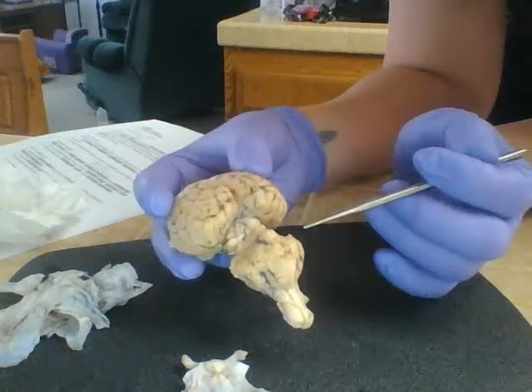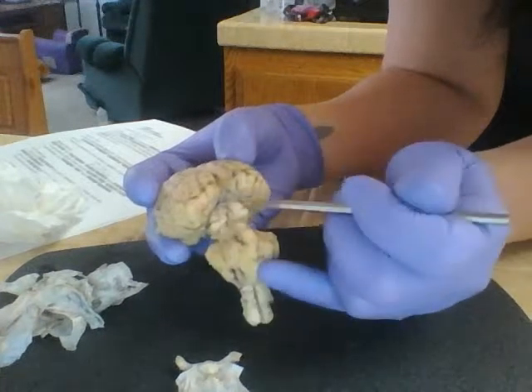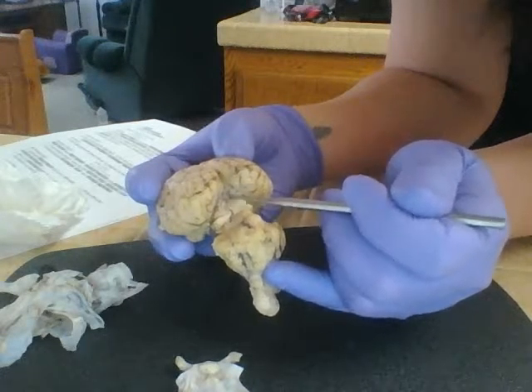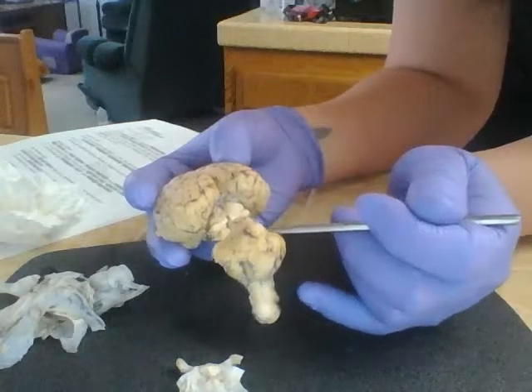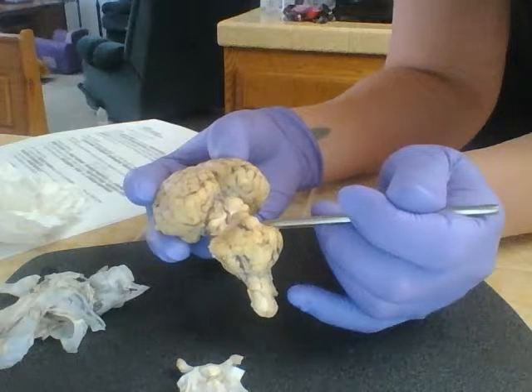And we have the superior colliculi, which are just under the pineal gland. The pineal gland, we can see he sits kind of right up in here. Kind of hard to make out. He's not very big. He sits right up in this area. And so, like I said, the superior colliculi sits just under that, and then the inferior colliculi sits just under the superior. So we have pineal gland, superior colliculi, and then inferior colliculi.